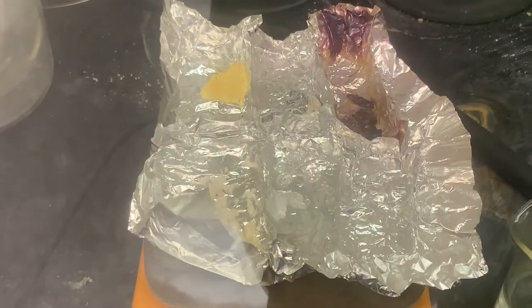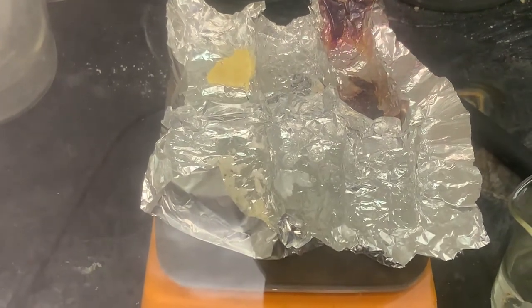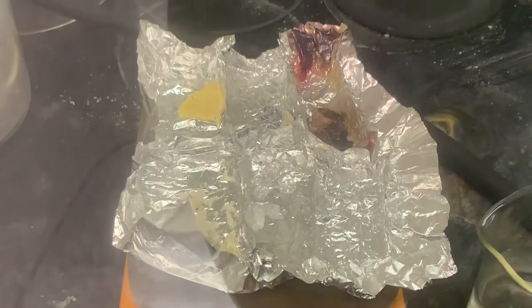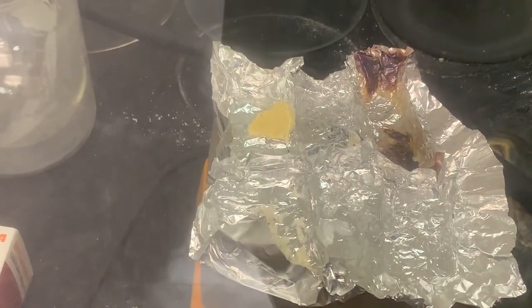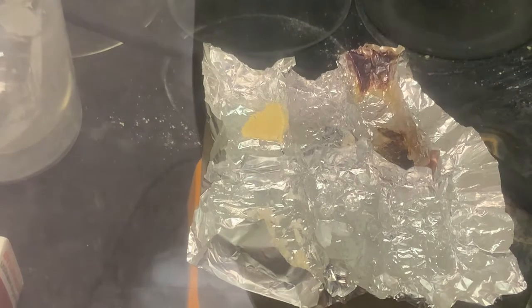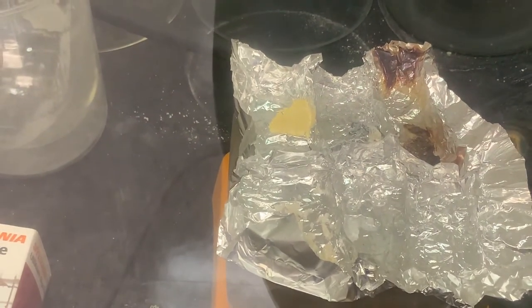You can see in the remainder that it appears that solid 4 has melted while solid 5 sublimed. The discoloration on sample 1 is not due to any change in the actual compound — it's due to the gas that was evolved from sample 5. Samples 1, 2, and 3 appear to remain unchanged.